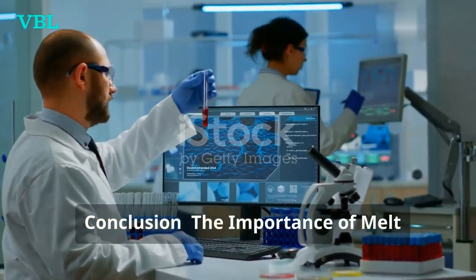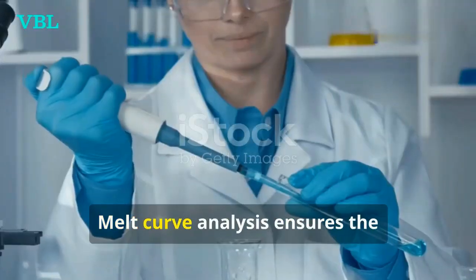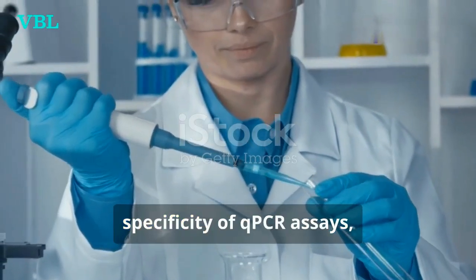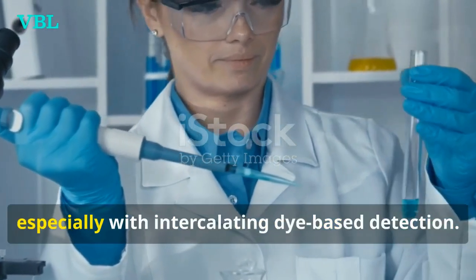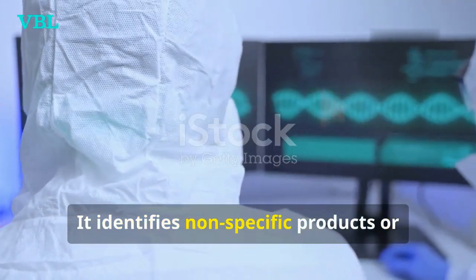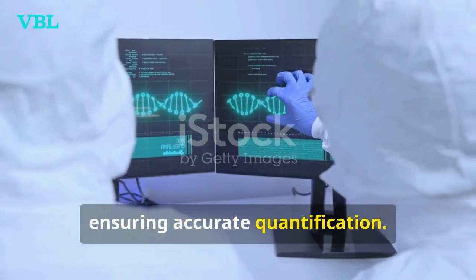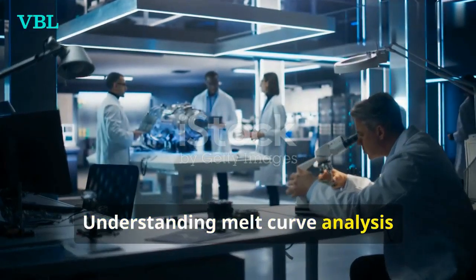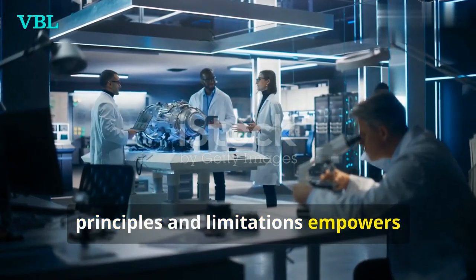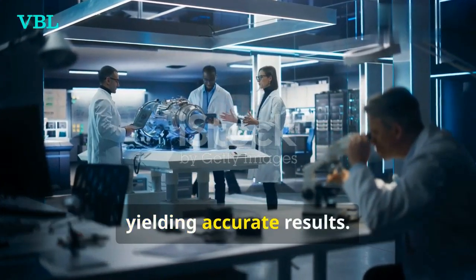Conclusion: the importance of melt curve analysis in qPCR. Melt curve analysis ensures the specificity of qPCR assays, especially with intercalating dye-based detection. It identifies non-specific products or primer dimers, ensuring accurate quantification. Understanding melt curve analysis principles and limitations empowers researchers to perform reliable qPCR experiments, yielding accurate results.